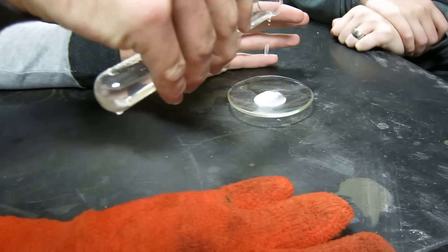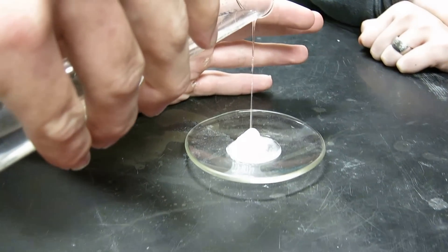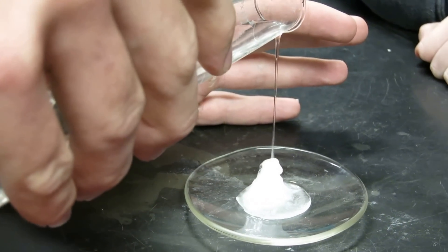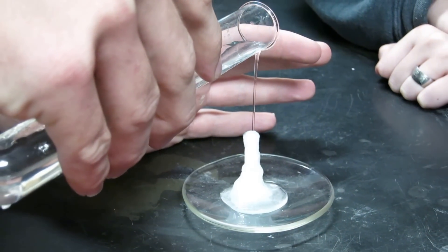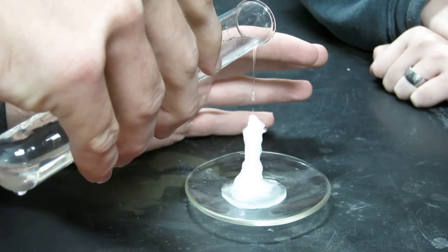Look at it go. What the heck? It seems like it should fall over. A tower of sodium acetate coming out of the supersaturated solution.